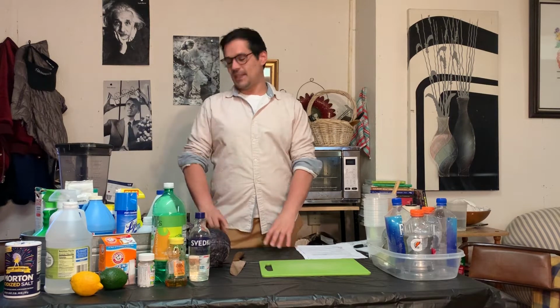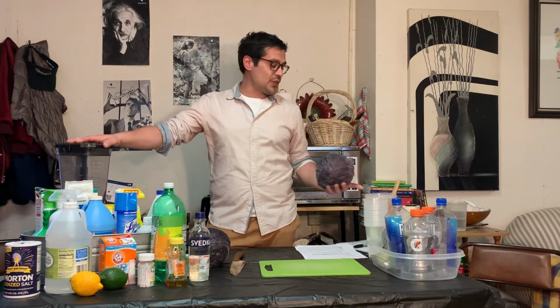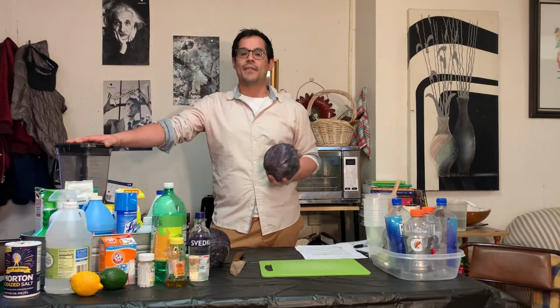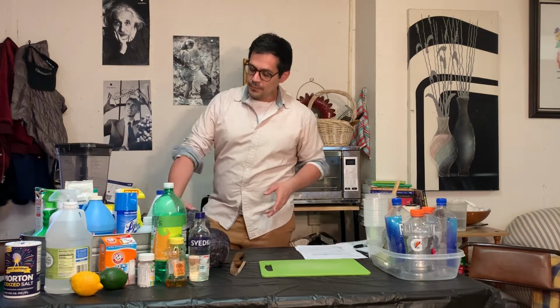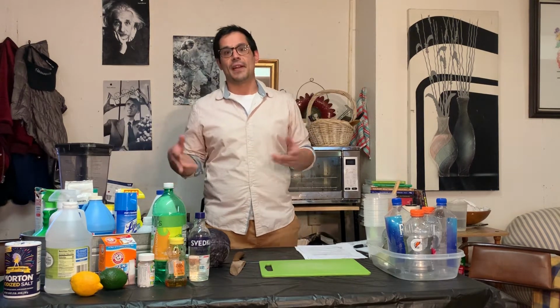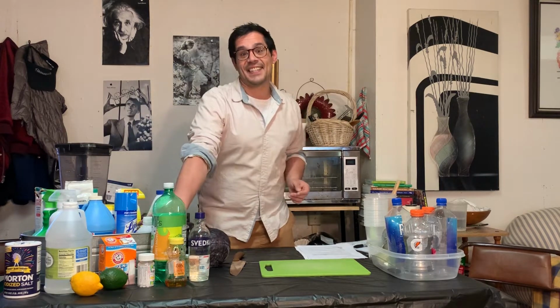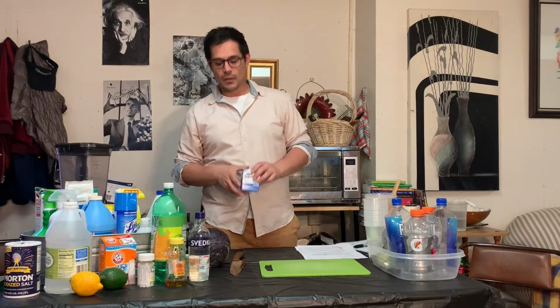So what we're going to be doing is extracting red cabbage indicator from whole red cabbage using water. And we'll be using this juice that we decant off as a universal indicator to test household products. The indicator will turn red in the presence of an acid, and it will turn blue in the presence of a base. Some things I have that are known, like some acetic acid will turn red, and then an antacid will be basic, turning blue when we test it.